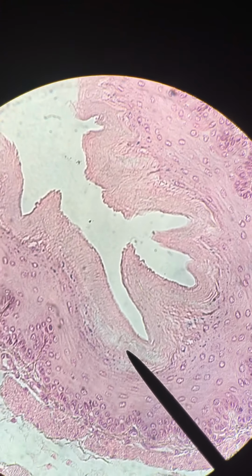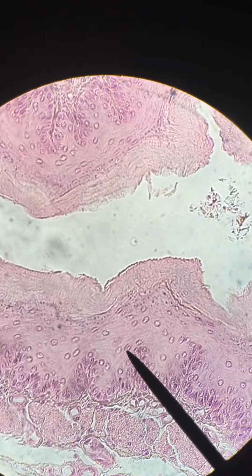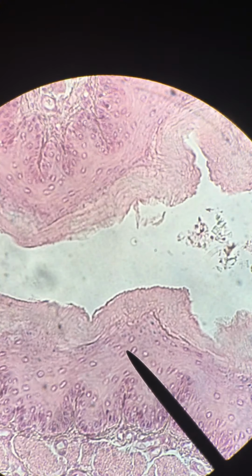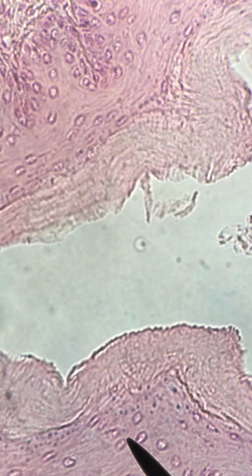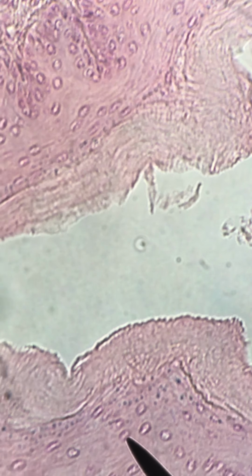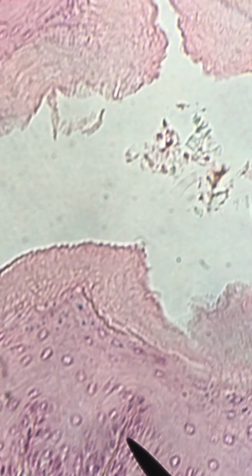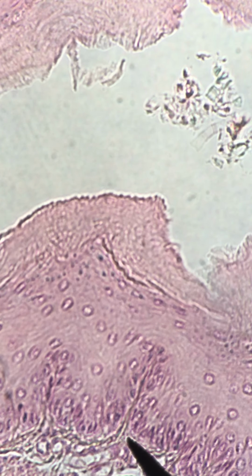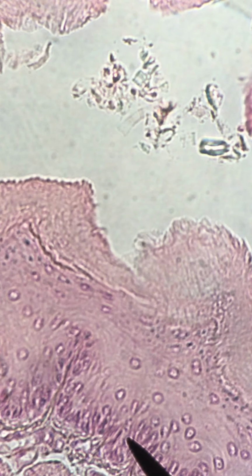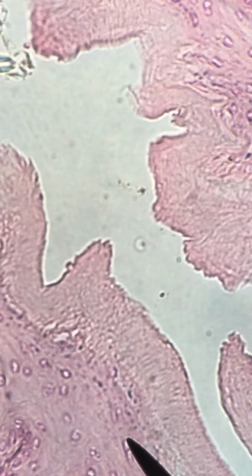And this is obviously multicellular, and the topmost, the apical surface is squamous cells. So I'm going to try to get that a little bit clearer for you, but this is the greatest magnification we can get. But hopefully you can see that we have, first of all, obviously stratified epithelium, and that there are squamous cells lining it.